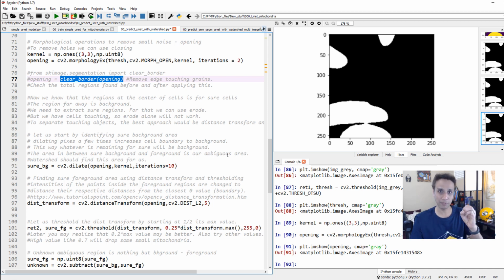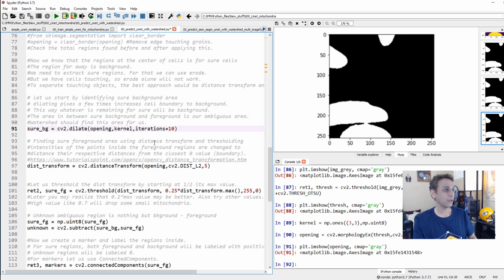So I'm not going to do that. But if you have tiny objects spread all over the image, and you want accurate object analysis, then you may want to remove these border objects. So I'll leave that line over there. But now let's go ahead and find our sure background. Remember, we talked about sure background. Hey, I'm sure this is mitochondria, I'm sure this is background, and I am not sure what's in between, right? That's exactly what we are trying to define.